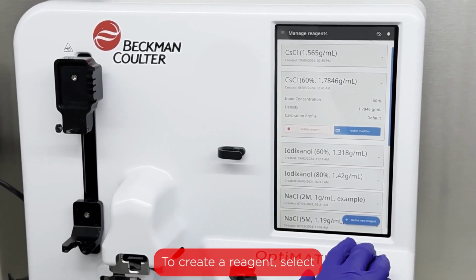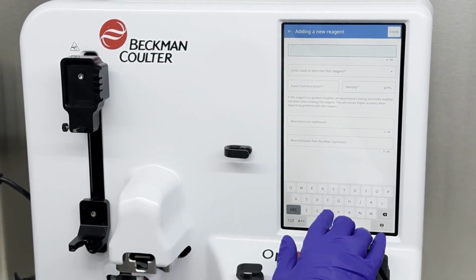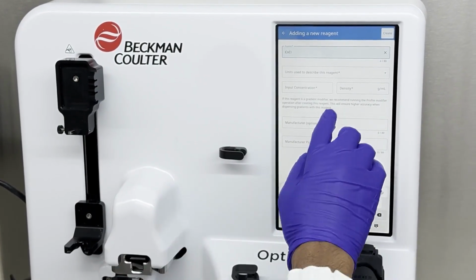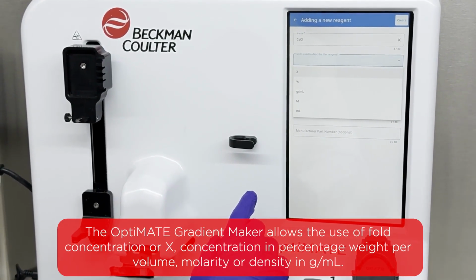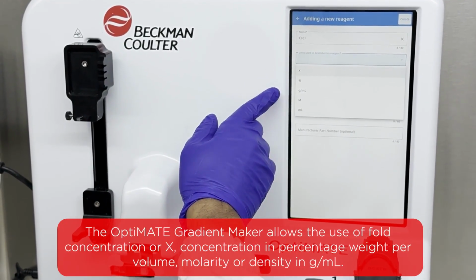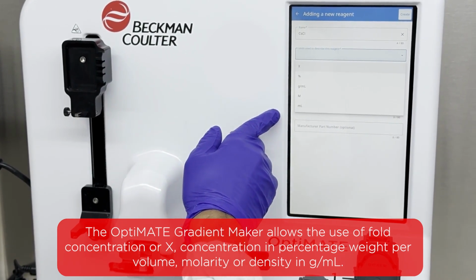To create a reagent, select Define New Reagent from the Manage Reagents menu. Provide a unique name for the reagent. Select the units used to describe this reagent from the drop-down menu. The OptiMATE gradient maker allows the use of fold concentration, or X, concentration in percentage weight per volume, molarity, or density in grams per mL.